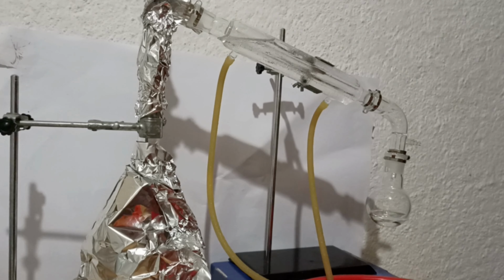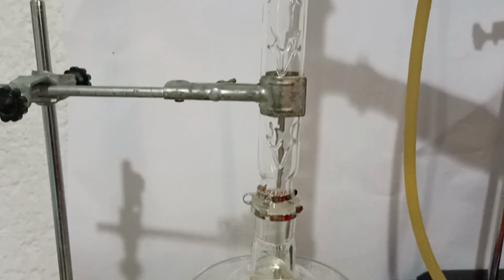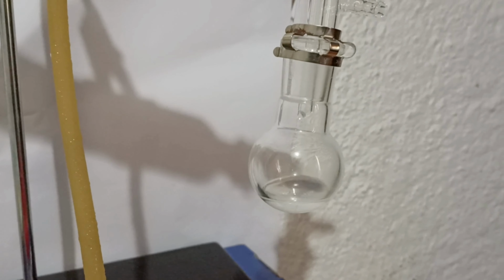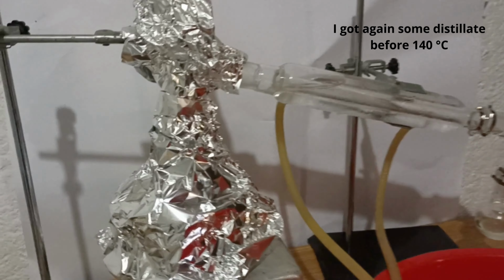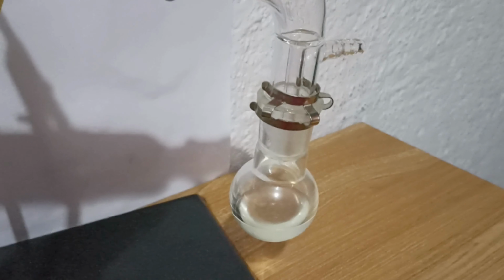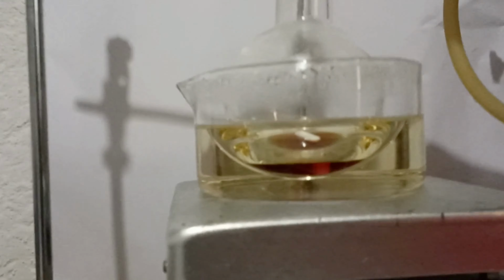The distillation occurred smoothly. After a while, the distillation stopped and the temperature dropped. I never got anything above 148 °C, so theoretically, I didn't get beta pinene. I removed the column and fixed a simple distillation apparatus in order to get a higher temperature easily. I did this because I wanted so badly to get beta pinene, but even though the bath was above 200 °C, I wasn't able to get anything above 150 degrees Celsius. I finally gave up and turned off the heat, finishing the distillation.